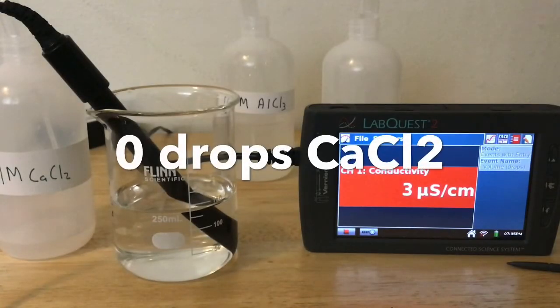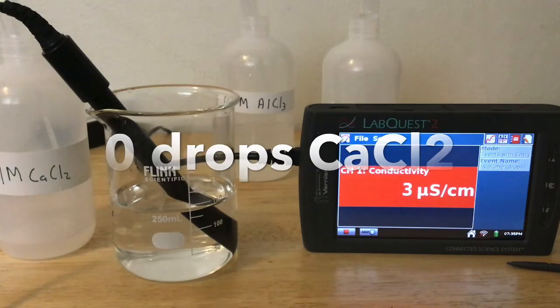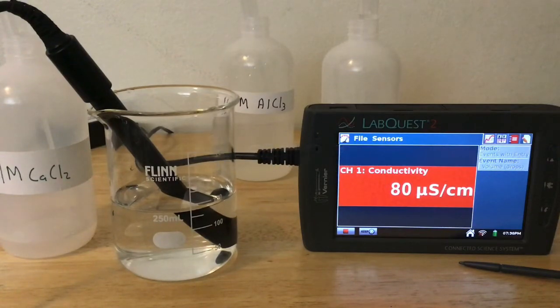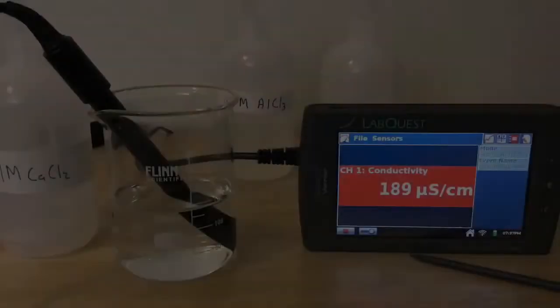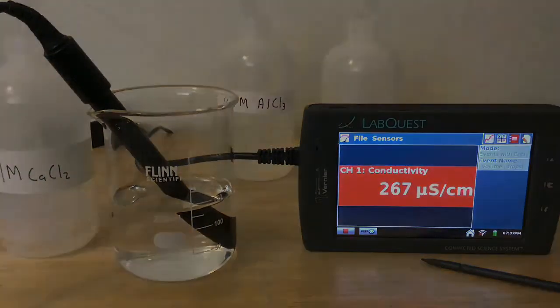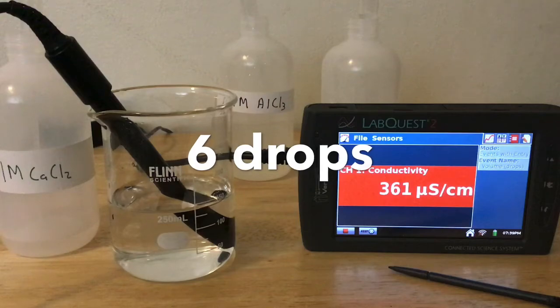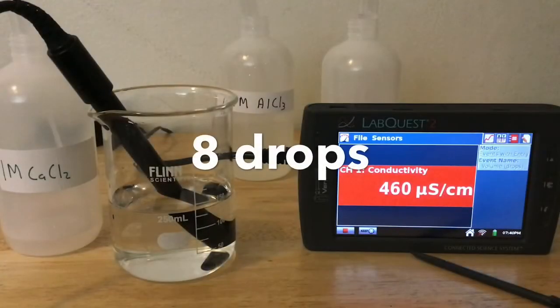So we'll be starting with our calcium chloride, and right now this is the measurement for 0 drops. 1 drop of calcium chloride. 2 drops. 3 drops. 4 drops. 5 drops. 6 drops. 7 drops. And 8 drops.